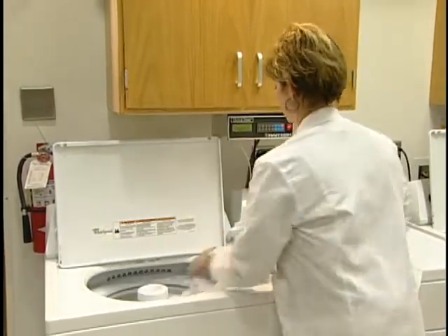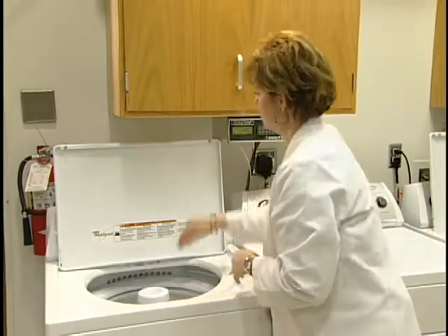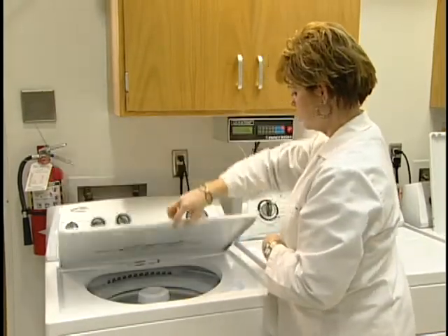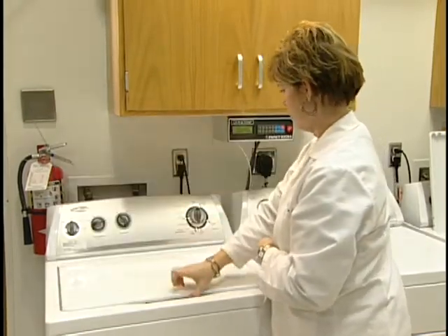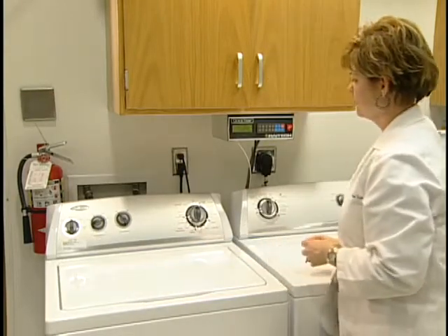The ballast pieces are cut to a 36-inch square. The washing cycle is 12 minutes, followed by extraction, rinsing, and extraction.